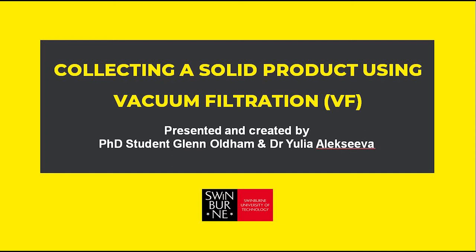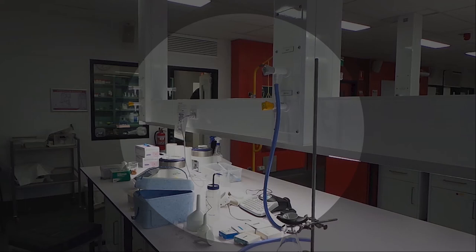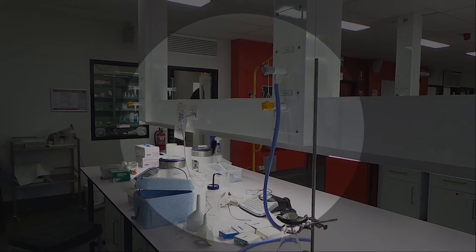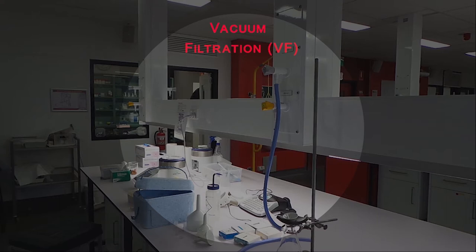Collecting a solid product using vacuum filtration. Vacuum or suction filtration is used to collect a solid product from the solution from which it was crystallized or precipitated — for example, crystals in a recrystallization procedure or a precipitate in some derivatization procedures. In this video we are going to discuss vacuum filtration.